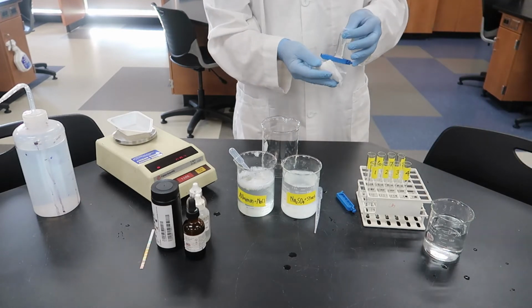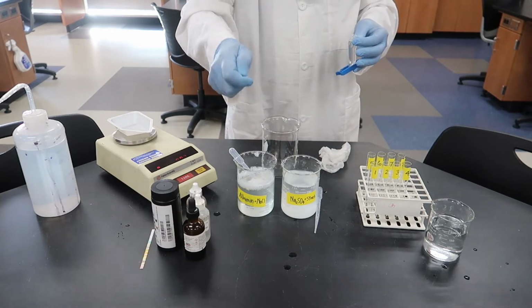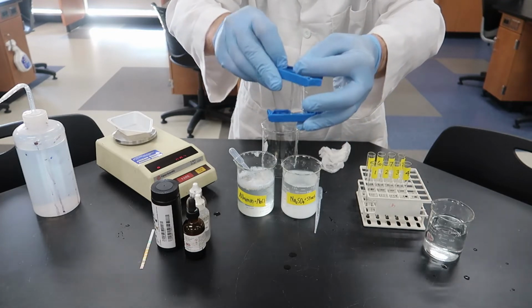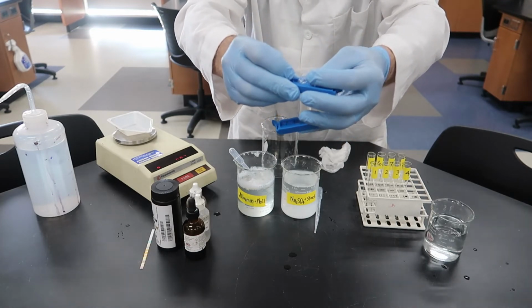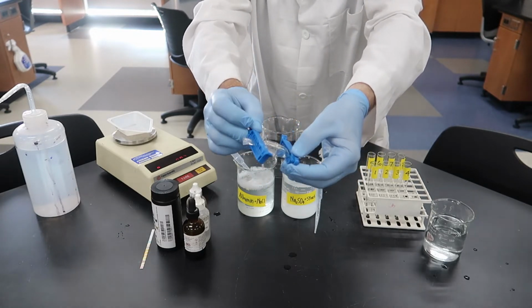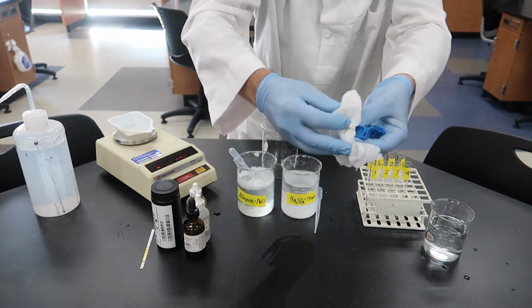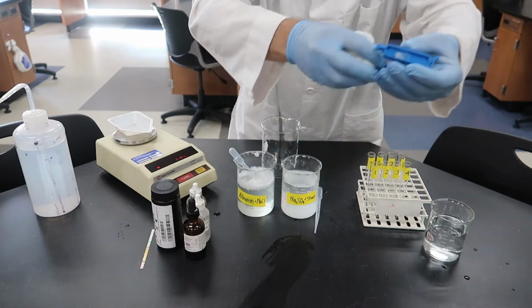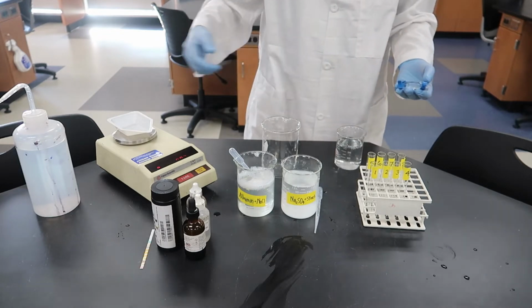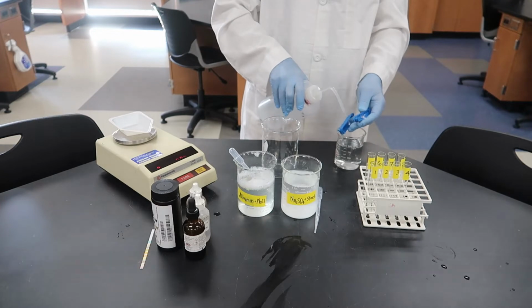Kind of dab off the extra liquid there, and we'll clamp off the other end of the tube. And you can see it just kind of hinges open, and then we need to make sure we squeeze it really tight to seal that bag. And then we're going to need to rinse it off so that we don't contaminate our beaker with any of the solution on the outside of the bag, because we were kind of messy there. So we'll clean that off a little bit, and I'll just use a little bit of the distilled water and rinse it.